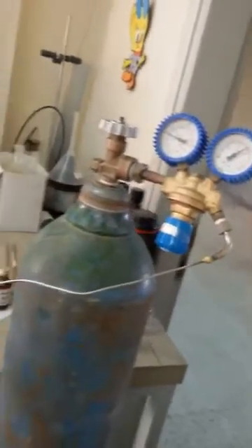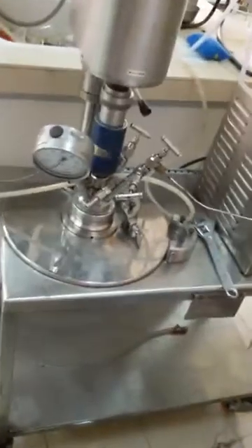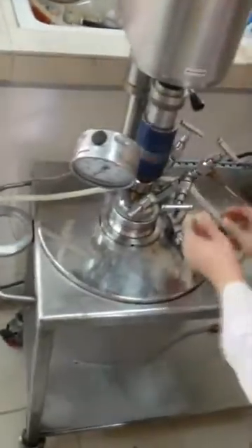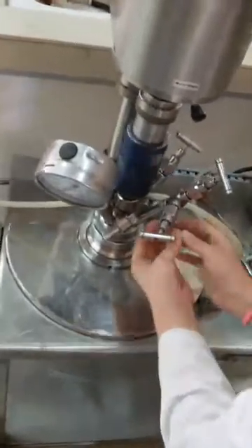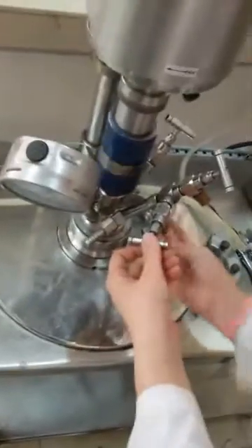And for the pressure — of course, for my own experiment I will open the pressure. I open this. First of all, let me close this and close this. We need to close it so the gas is not released.